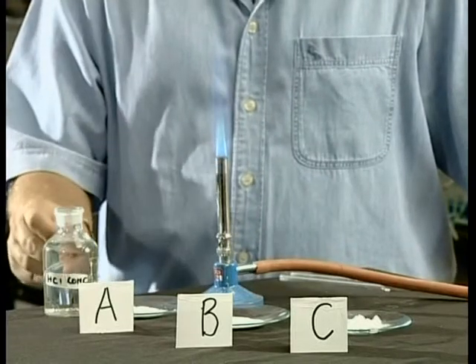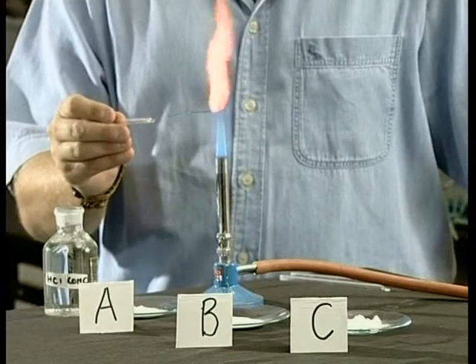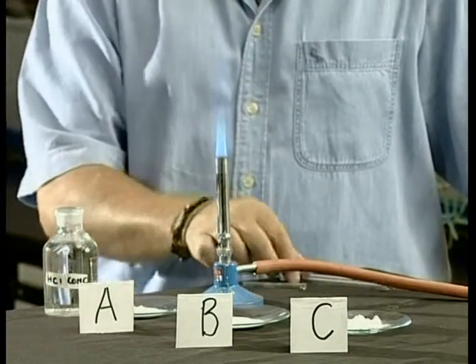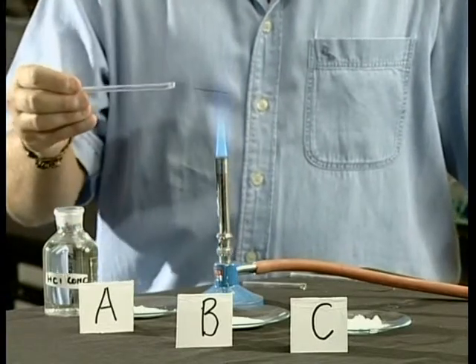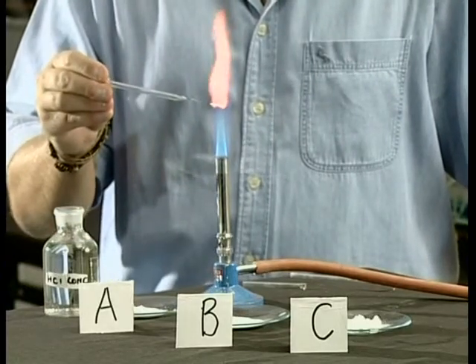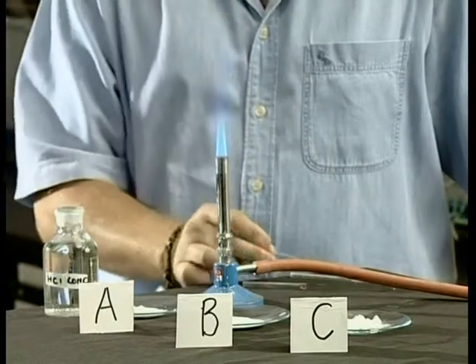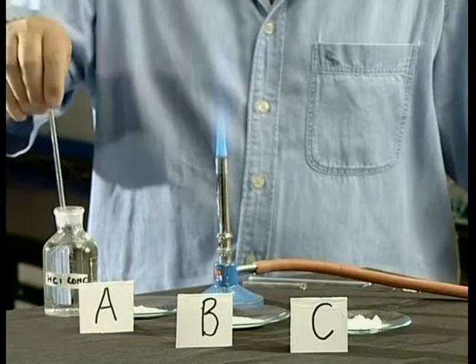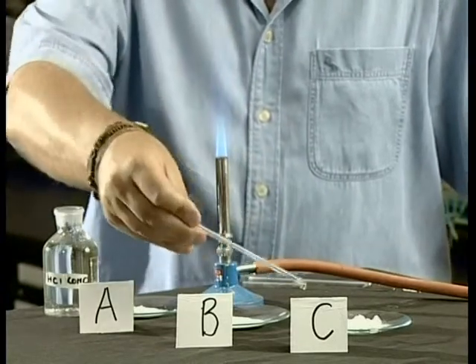We will begin with the flame test. We have to dip a piece of wire into each of our unknown salts. Ensure that the wire has a few grains of the salt on it, hold it over a Bunsen flame and carefully observe the colour of the flame. Remember to dip the wire in hydrochloric acid and hold it over the flame after testing each substance to ensure that it is clean. Now let's tabulate our observations and deductions.